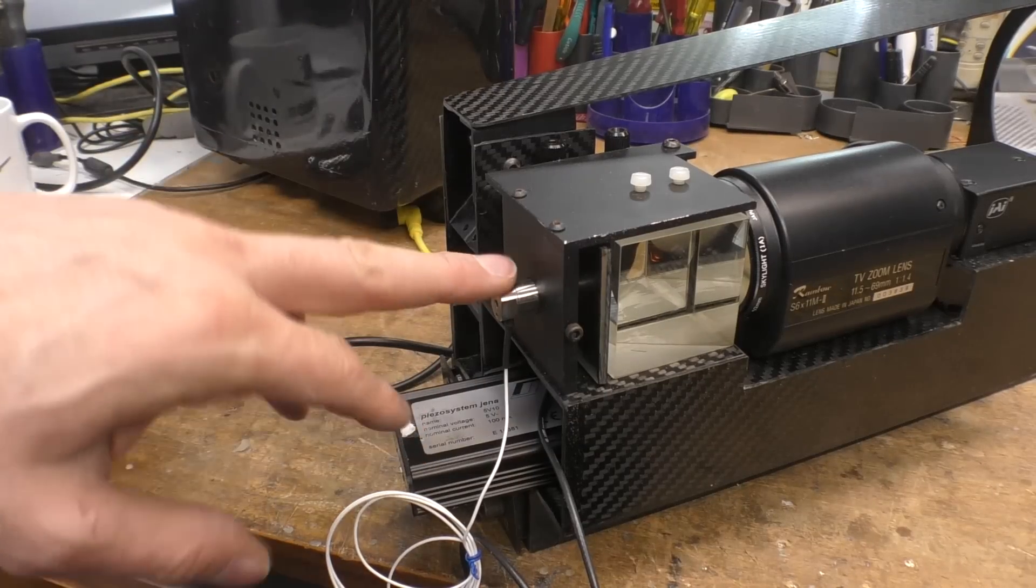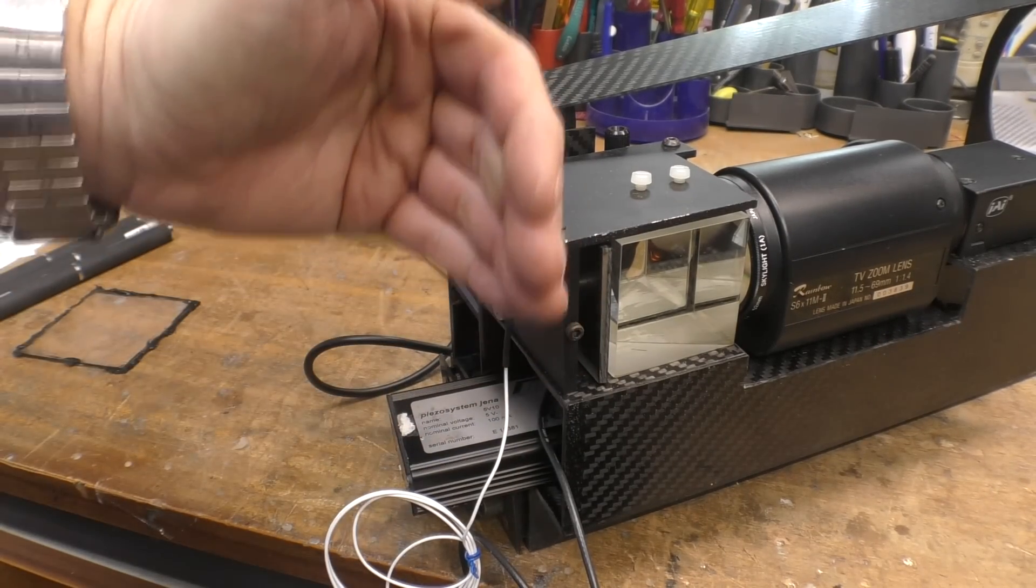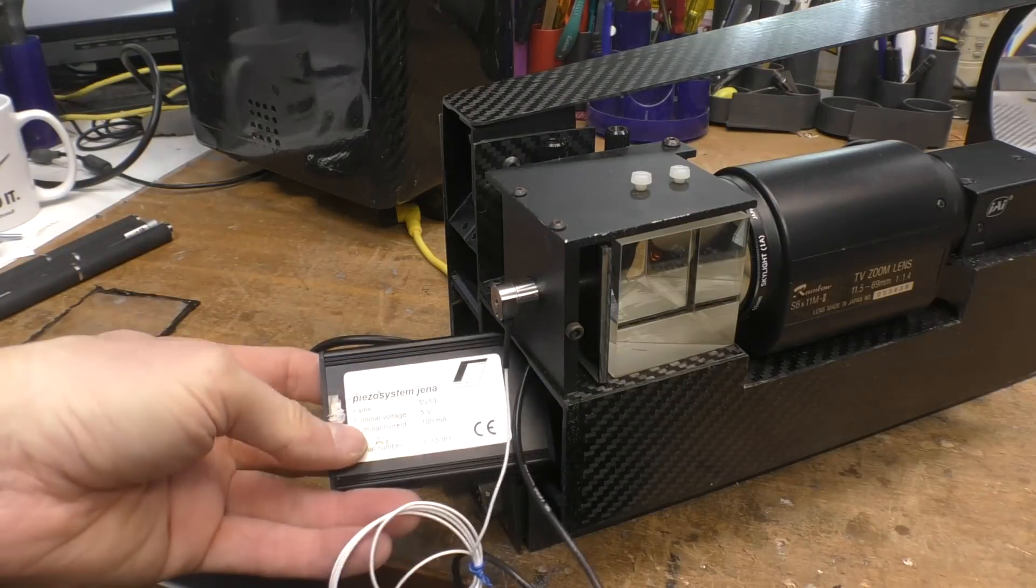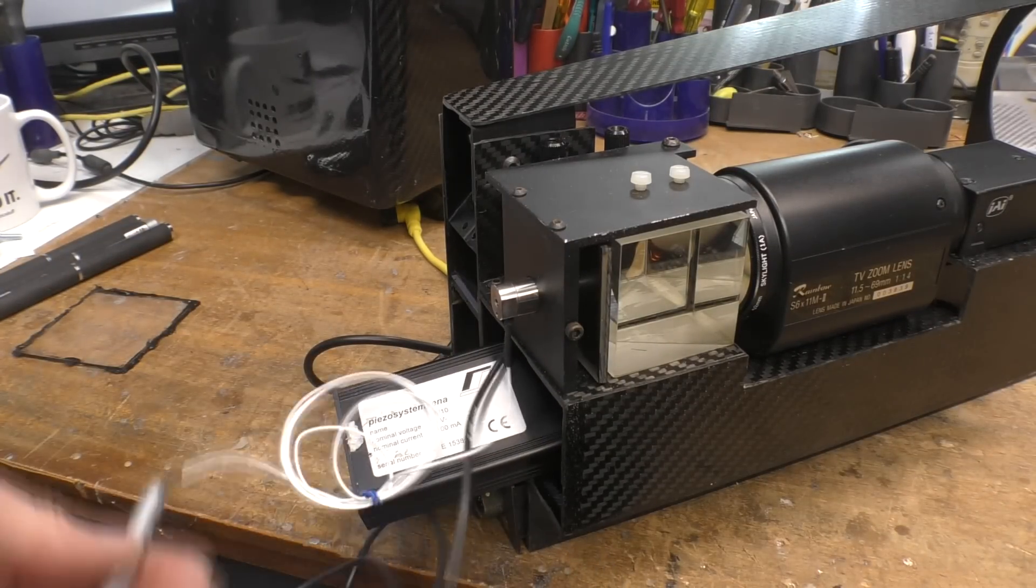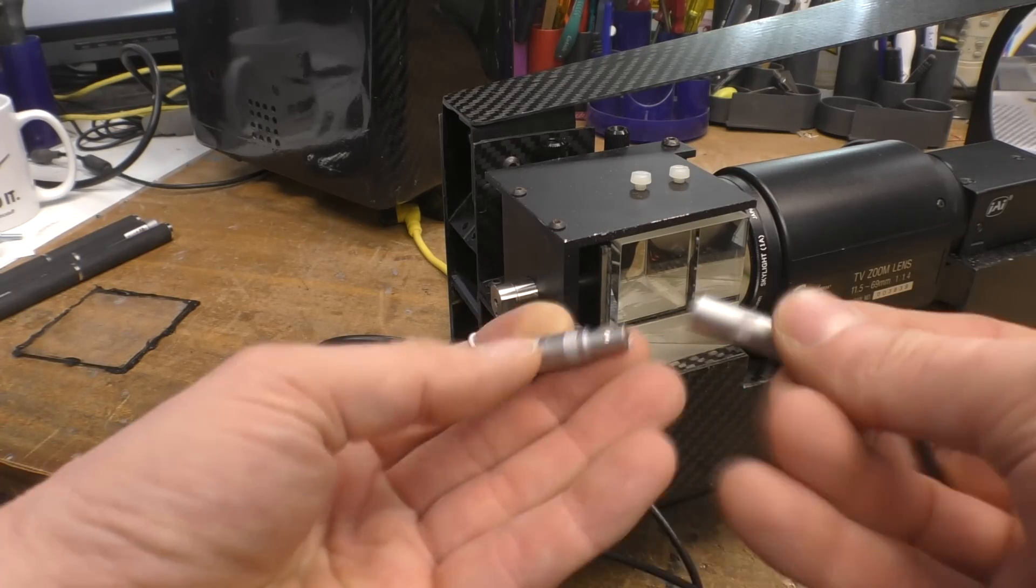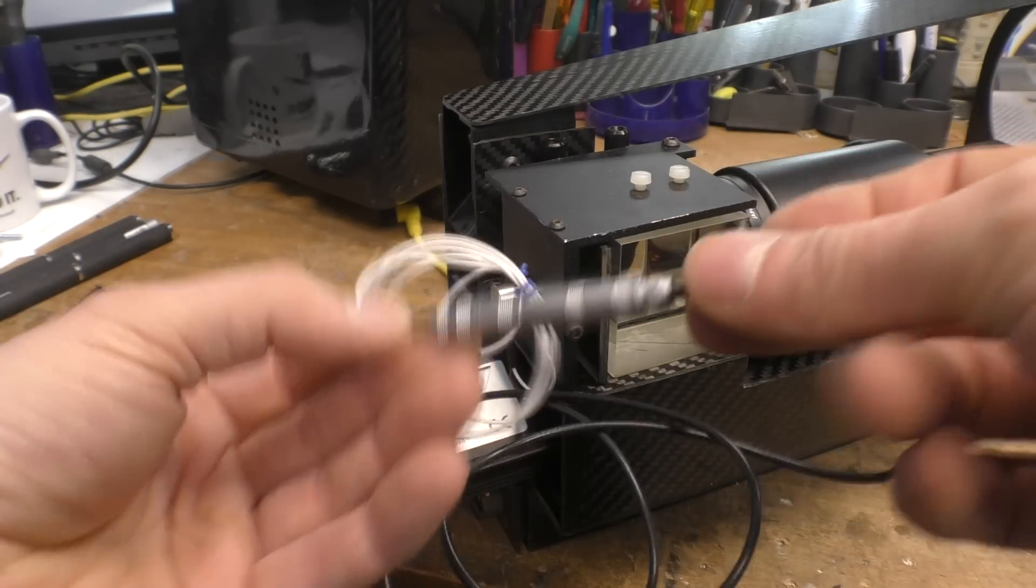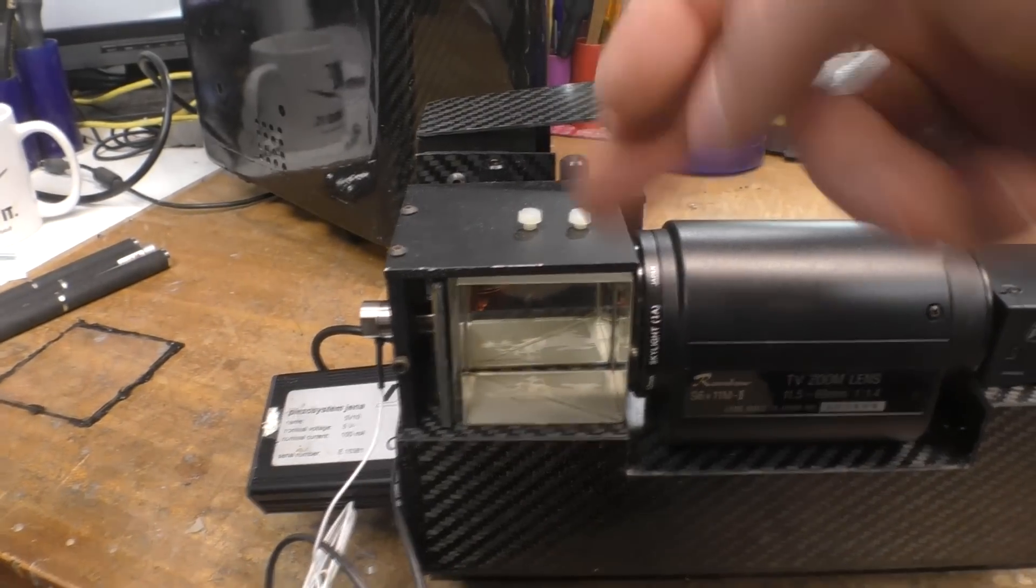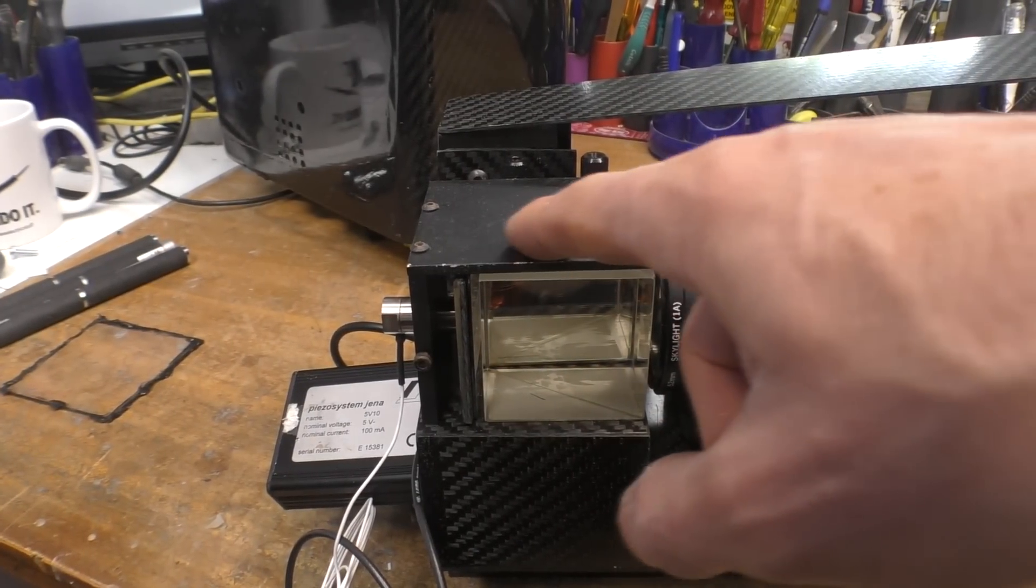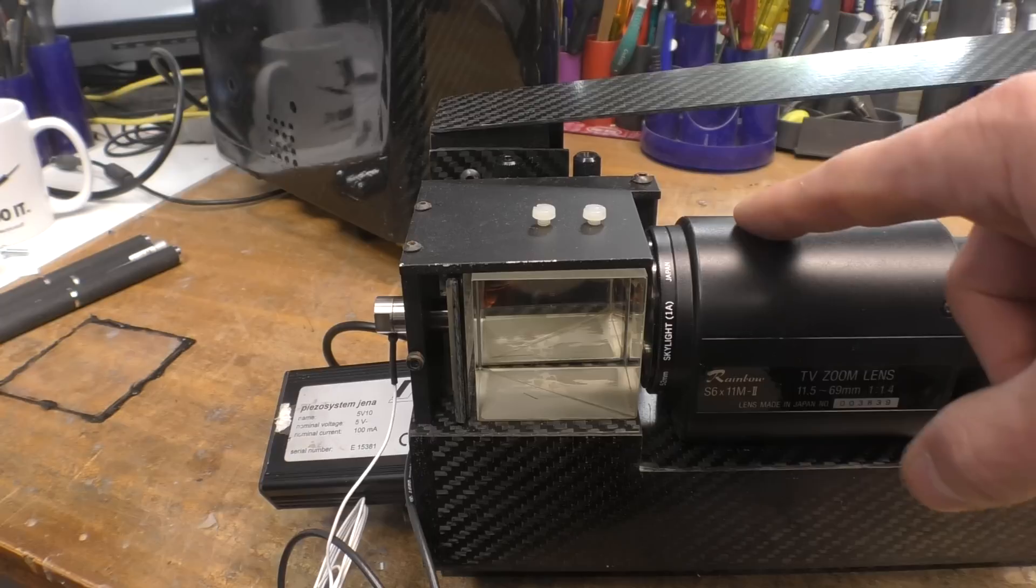With the camera, we've got this actuator. I think this is a piezo actuator which moves a mirror in this direction. There's a driver made by Piezo System Jena, and this couples via lovely expensive Lemo connectors. You know if something's got Lemo connectors it's really expensive. I'm fairly sure what's happening here is that light comes in, gets bounced horizontally onto this mirror on the piezo actuator, and then into the camera.